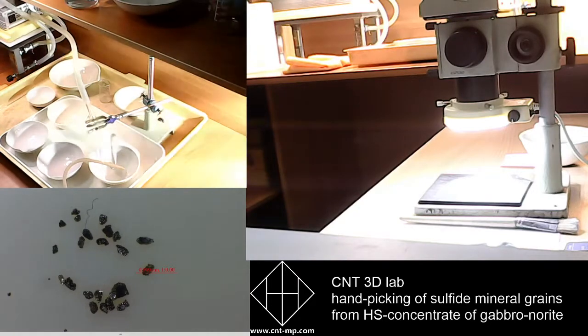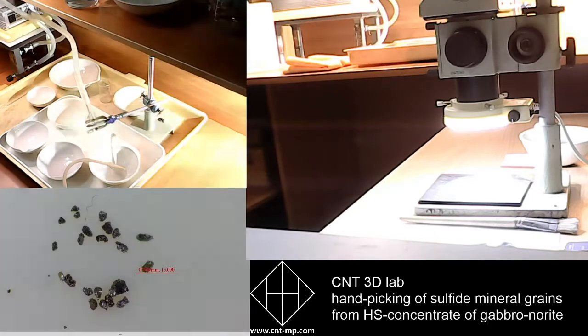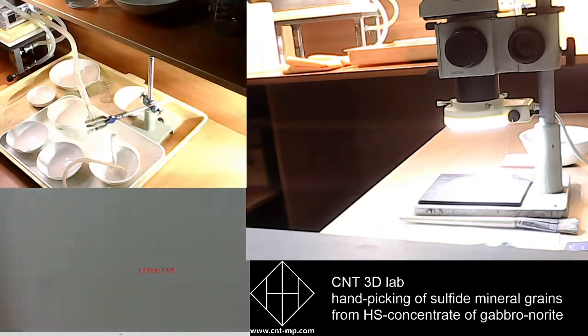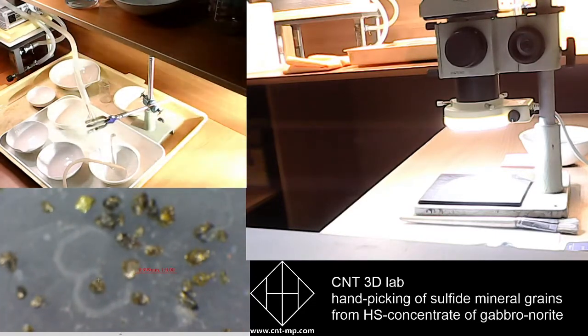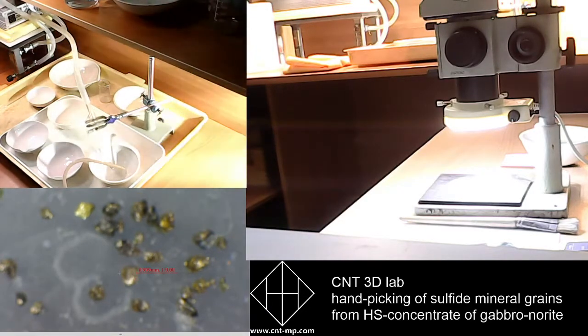Sorry, I have some troubles with the camera. And once again, this is a fraction 0.5, 0.25 millimeters.